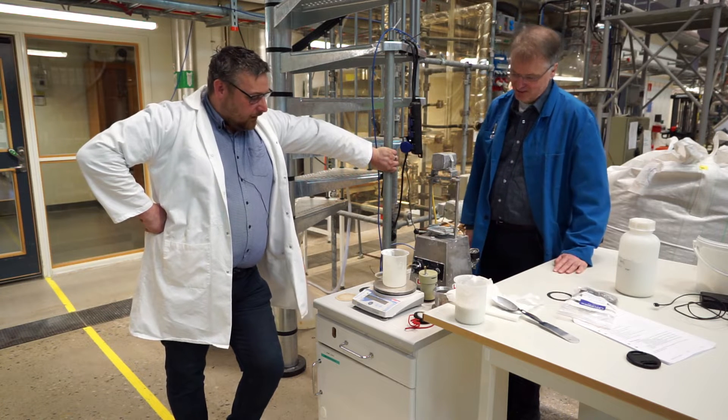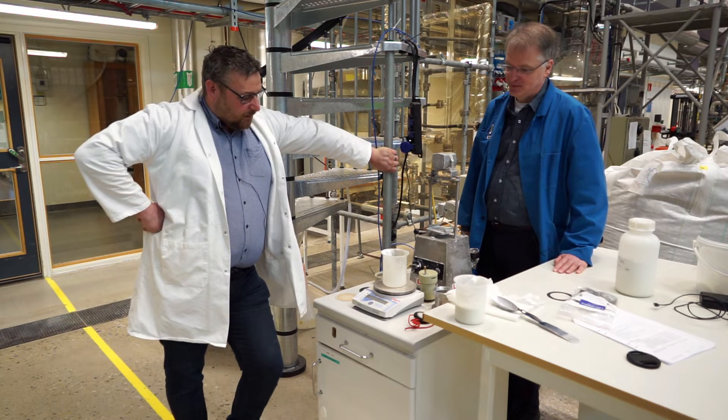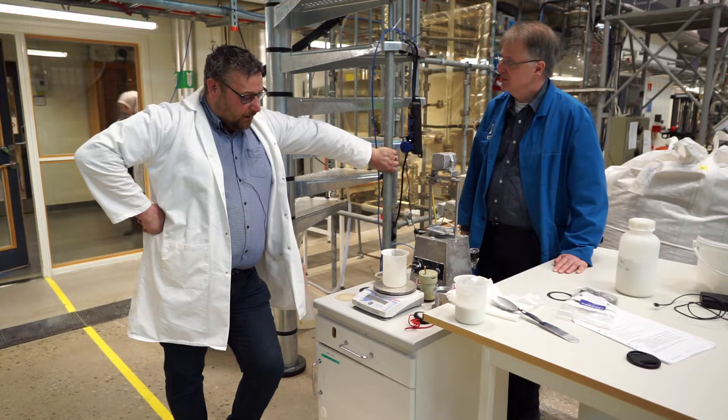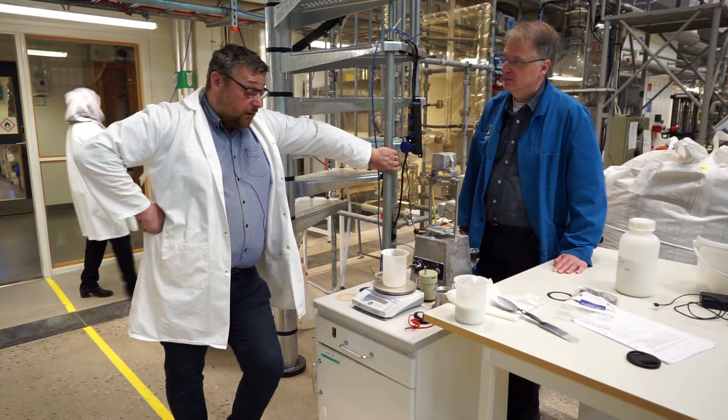Okay, so this equipment, what is this? This is a small filtration device that we can use to evaluate the filtration performance of different kinds of solutions.